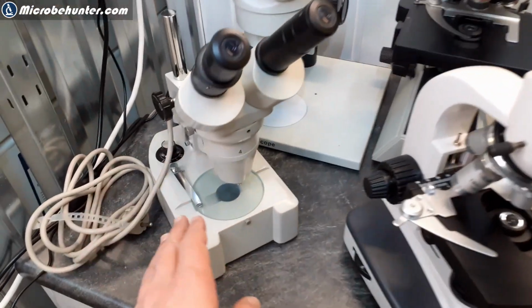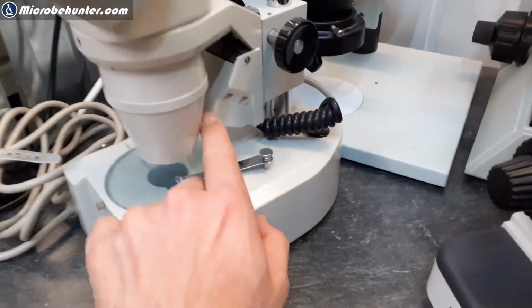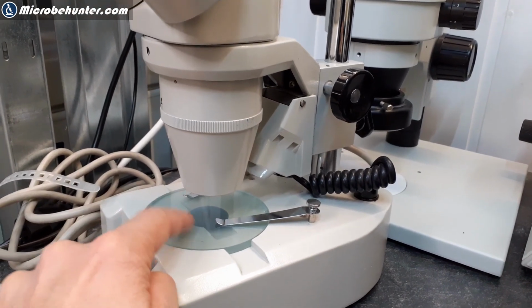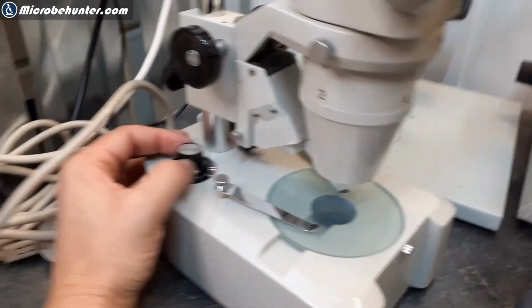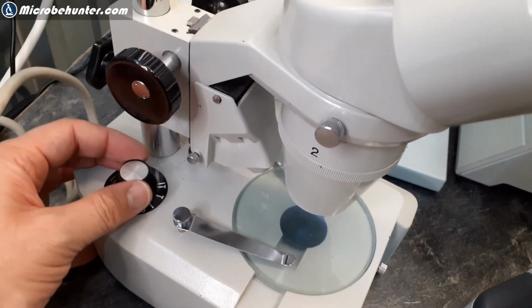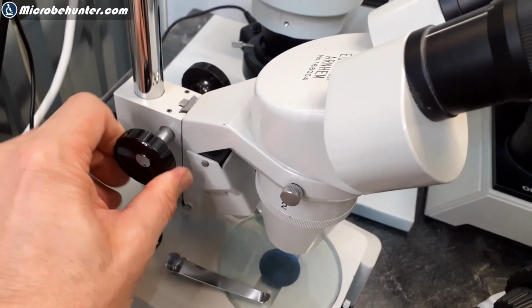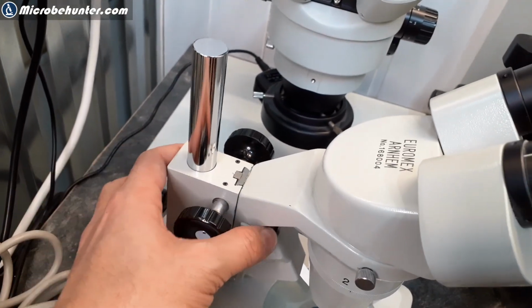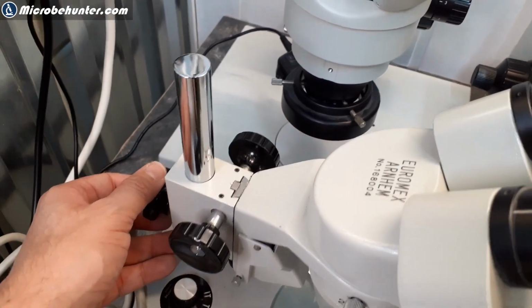Now, those stereo microscopes come in many cases with a light from the top. That's over here, it's difficult to see now. And this one also has a light coming from the bottom. I can switch this by turning this, it's not plugged in right now. So I'm able to either have the top light or the bottom light, no light, or both of them at the same time. Focusing is done by turning this knob over here, and if the range is not enough, I'm able to lift up the whole head by loosening this screw here. I'm not going to do this now because I also have to hold the camera.